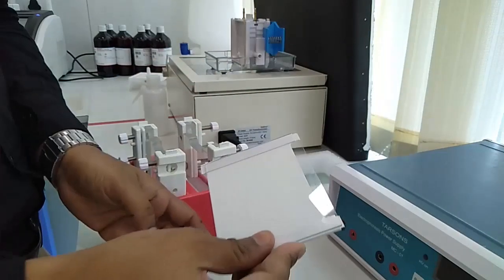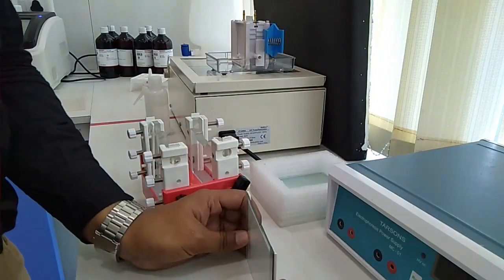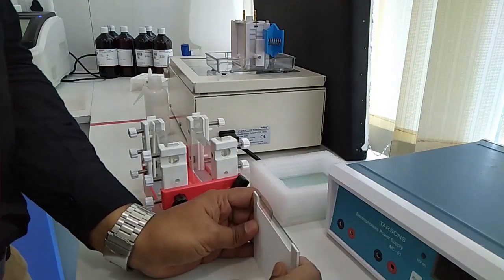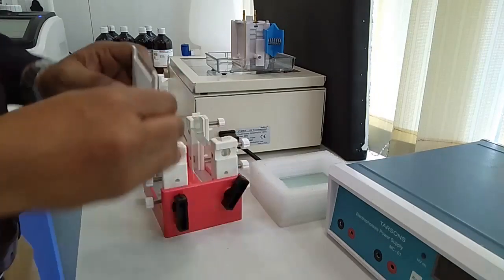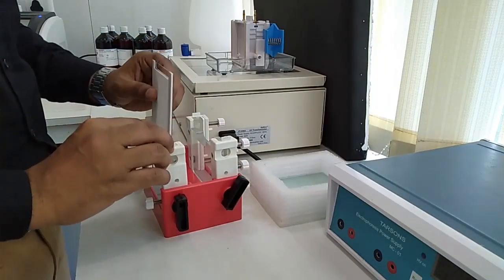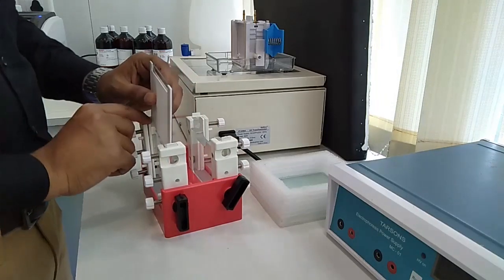Set it carefully. Make sure that there will be no leak. Let it be inserted into the caster. So let's turn it over.